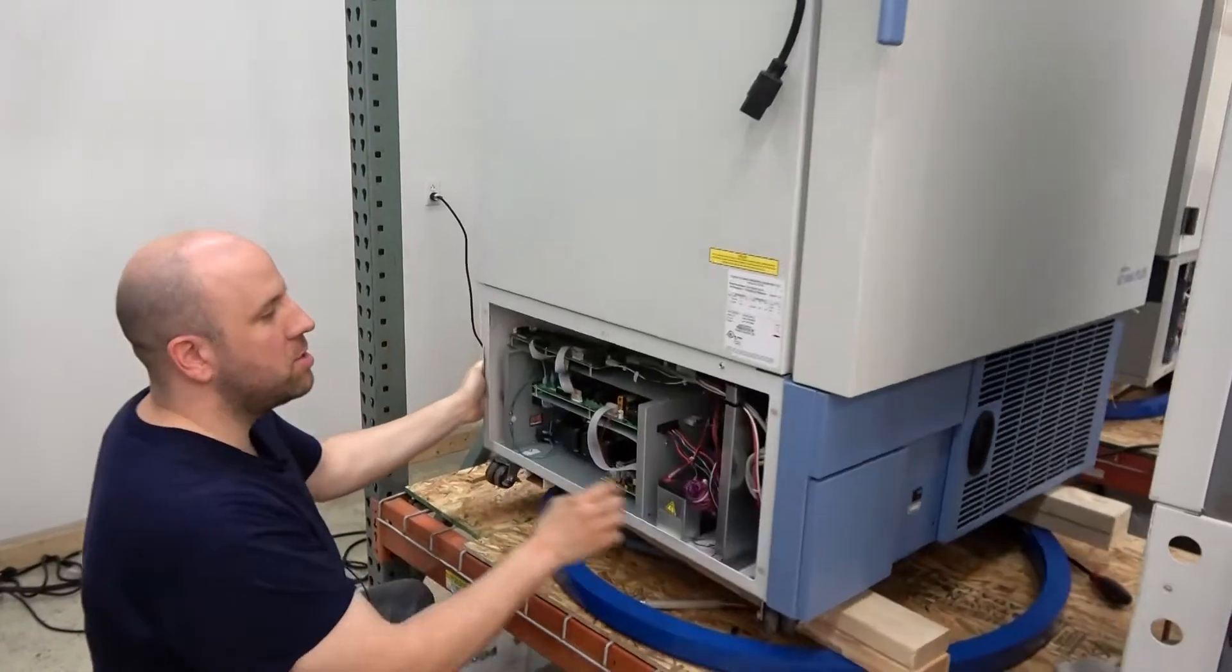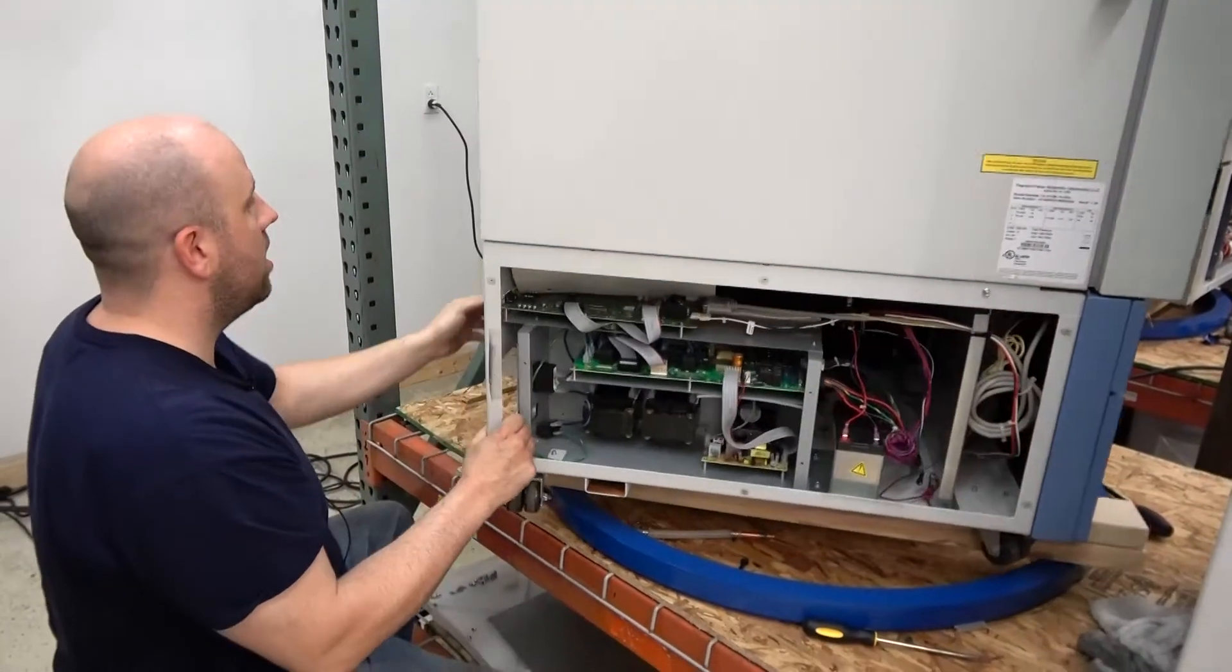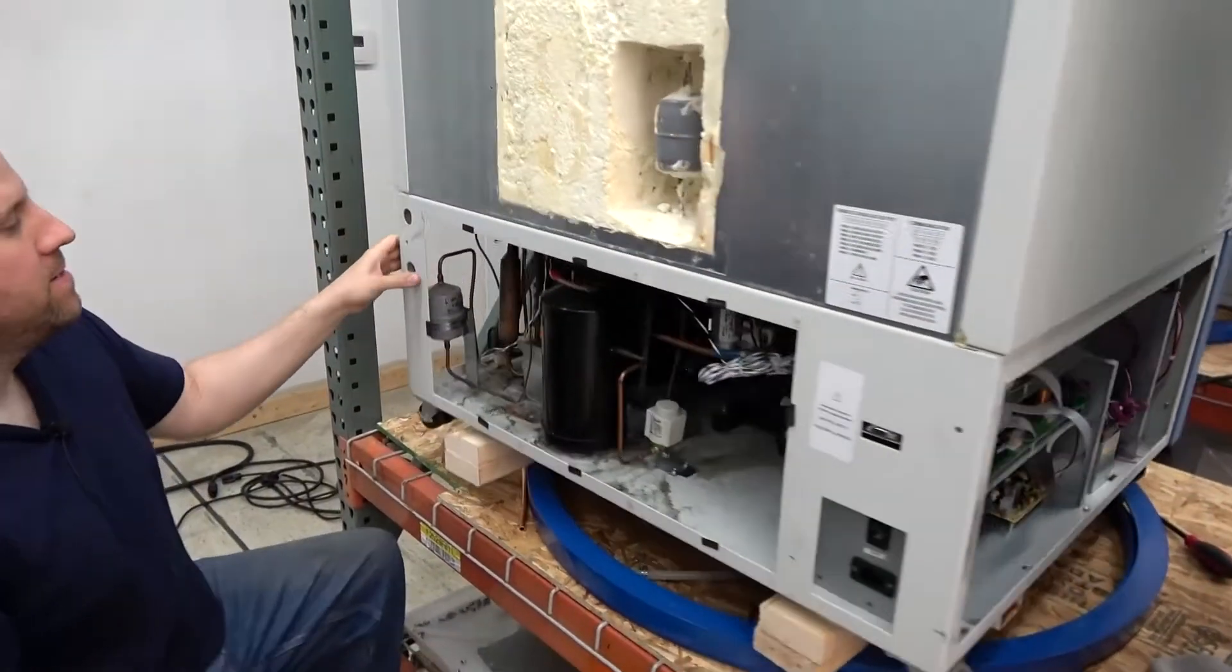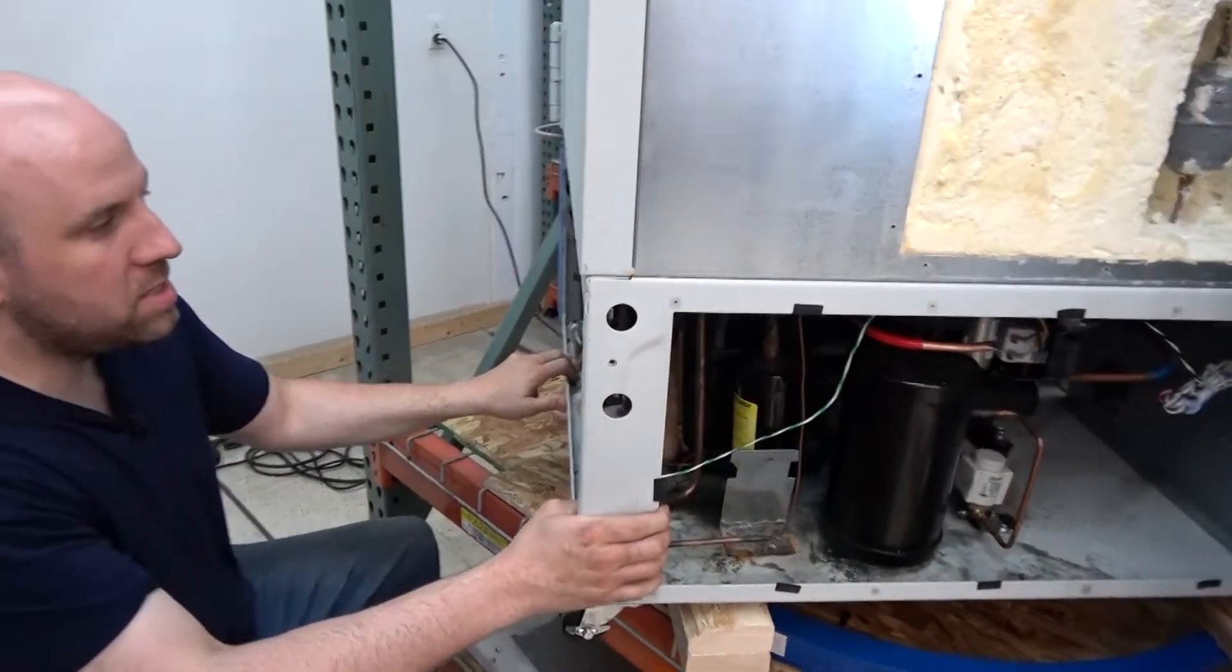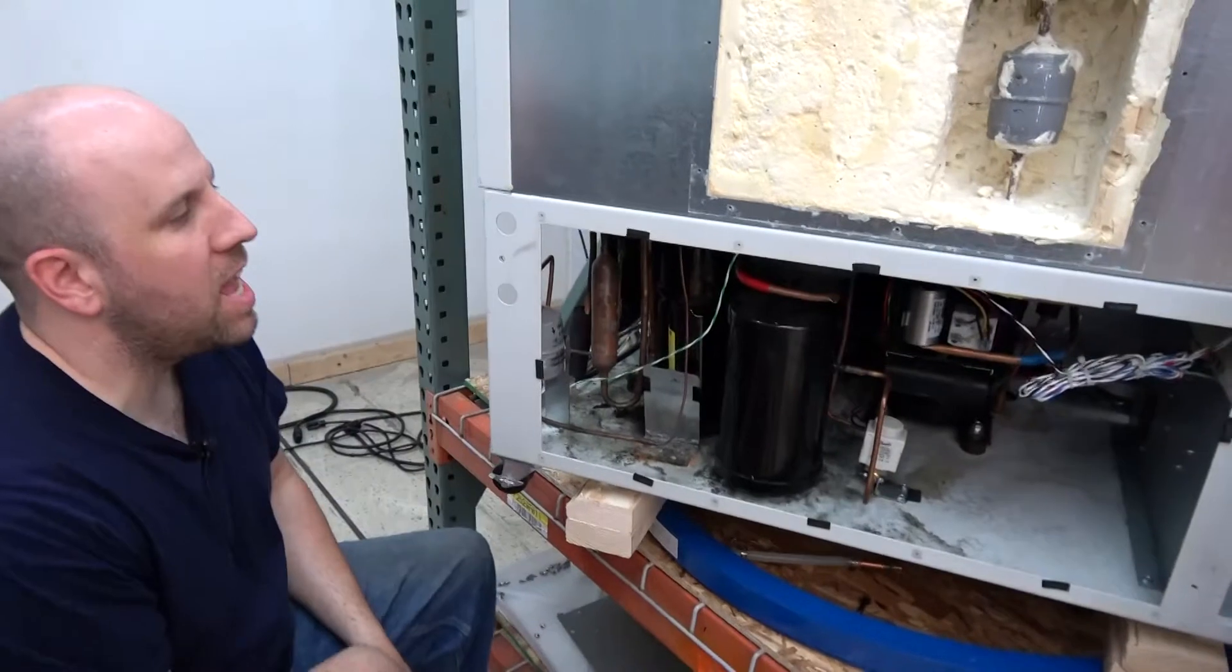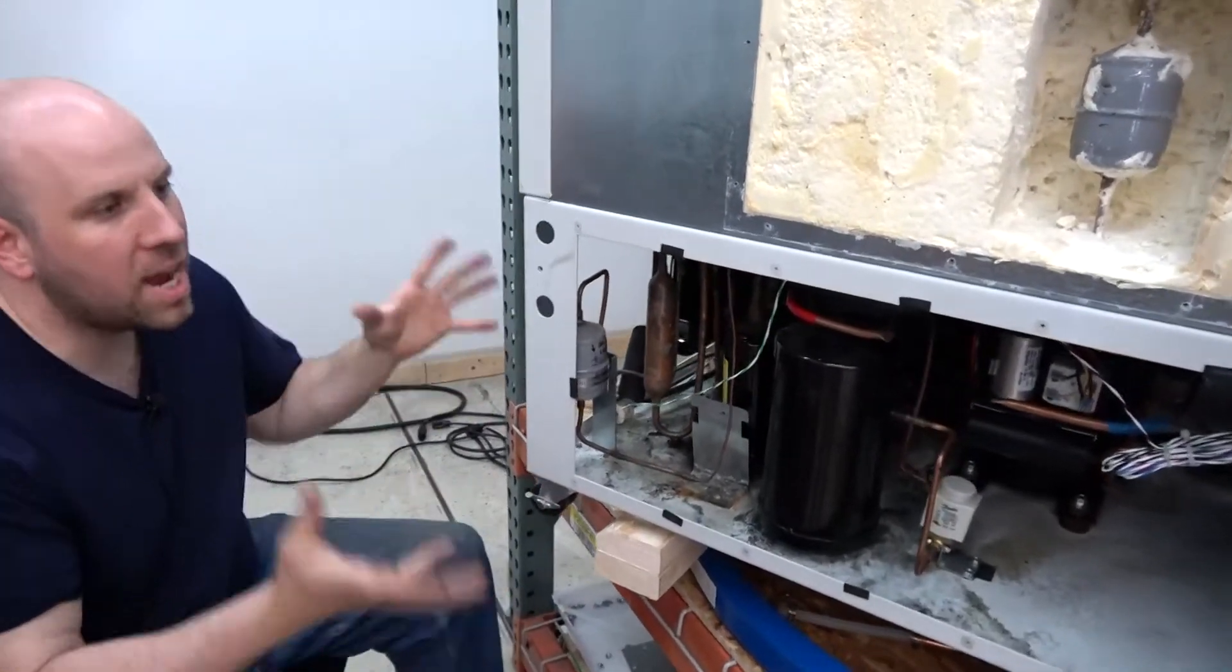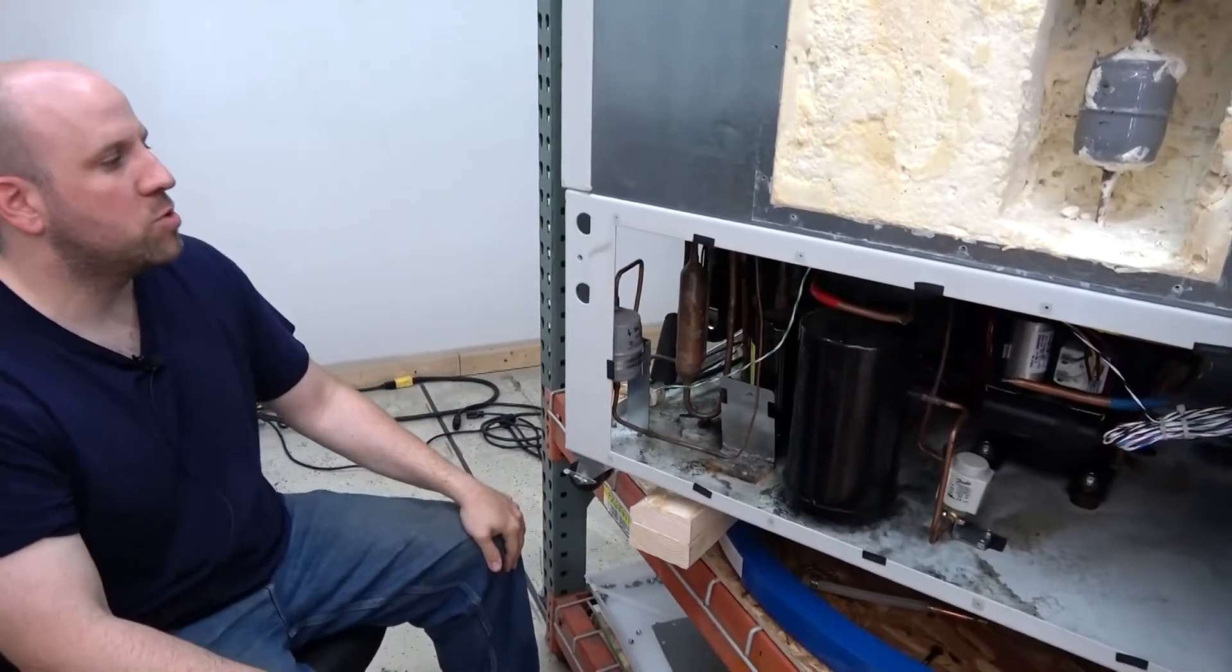Bear with me while I turn the old girl around here. All right. So this is the inside of a typical ultra-low freezer of this type.